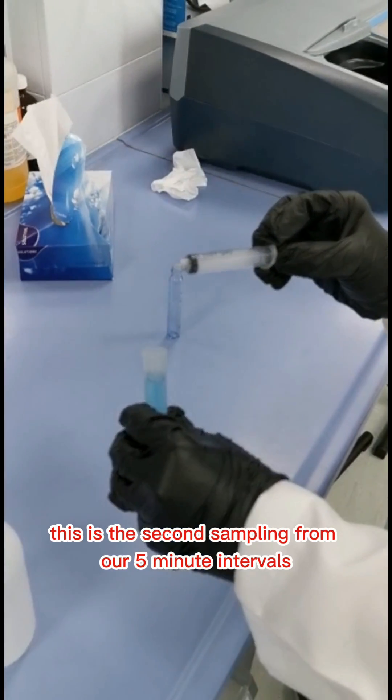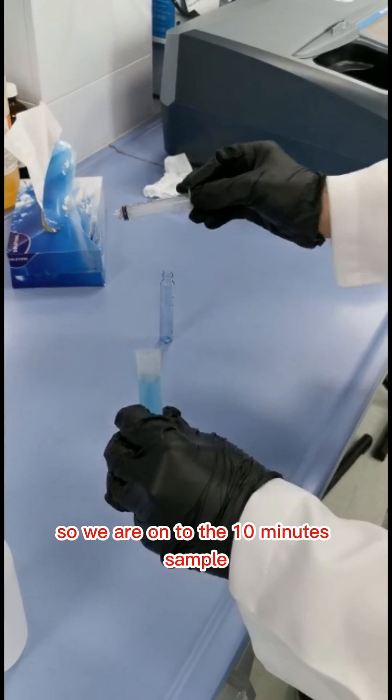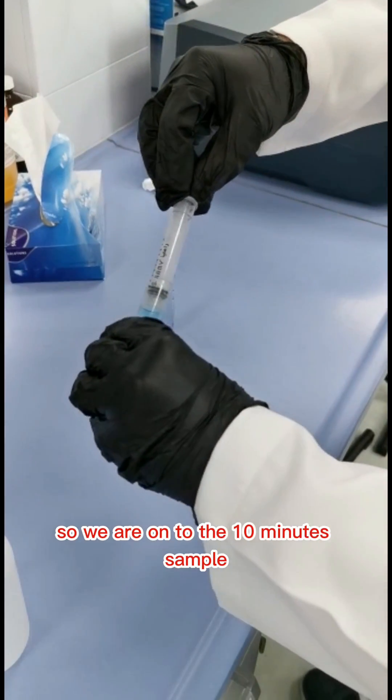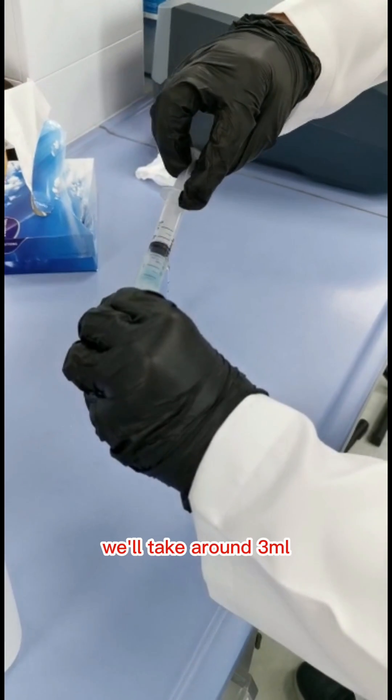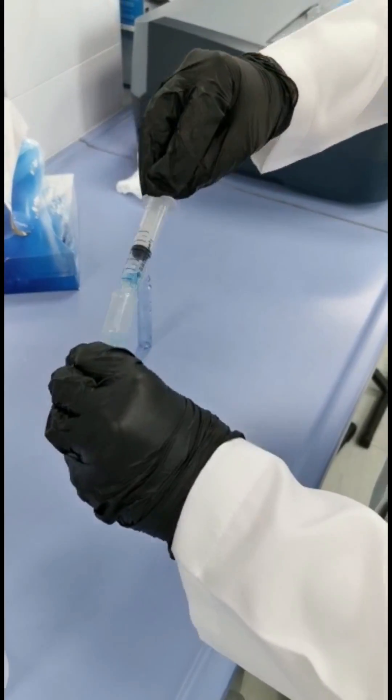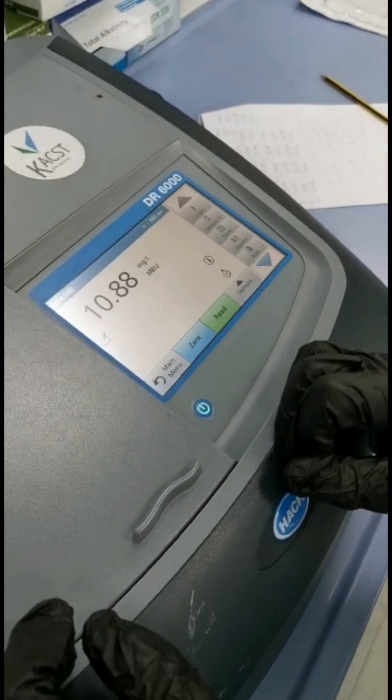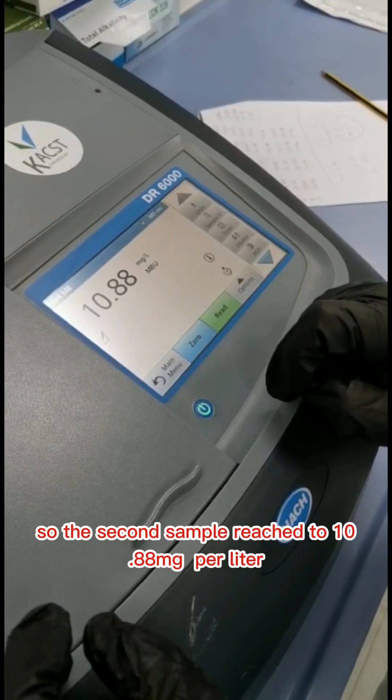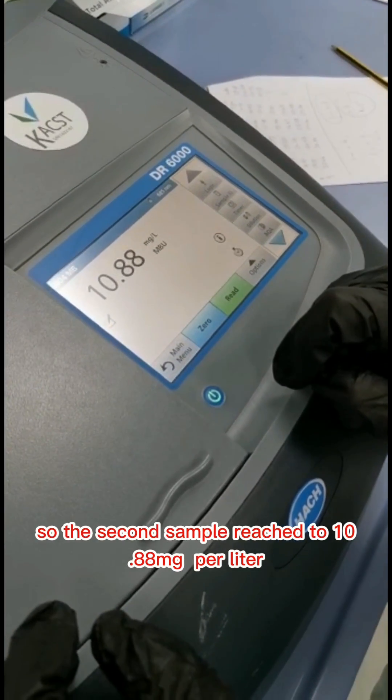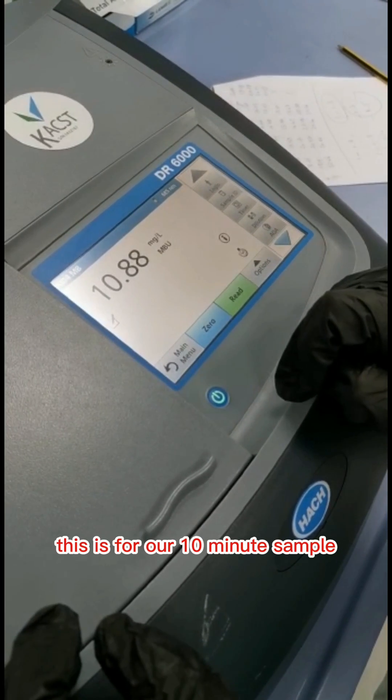This is the second sampling from our 5 minute intervals. We are on to the 10 minute sample. We will take around 3 ml. This is the second sample.